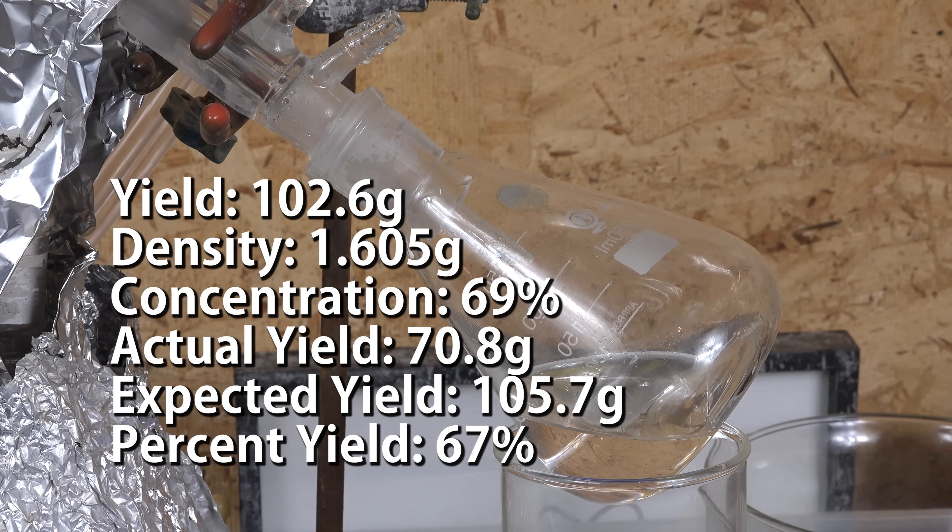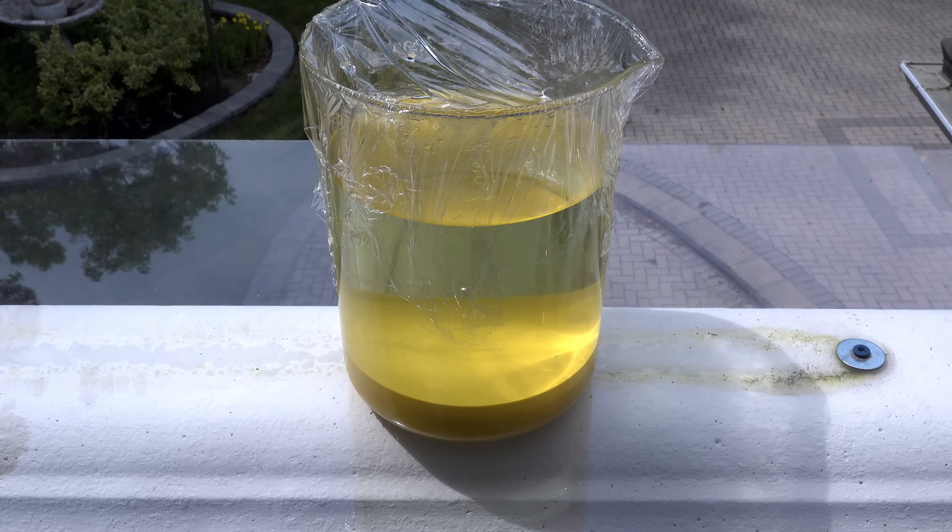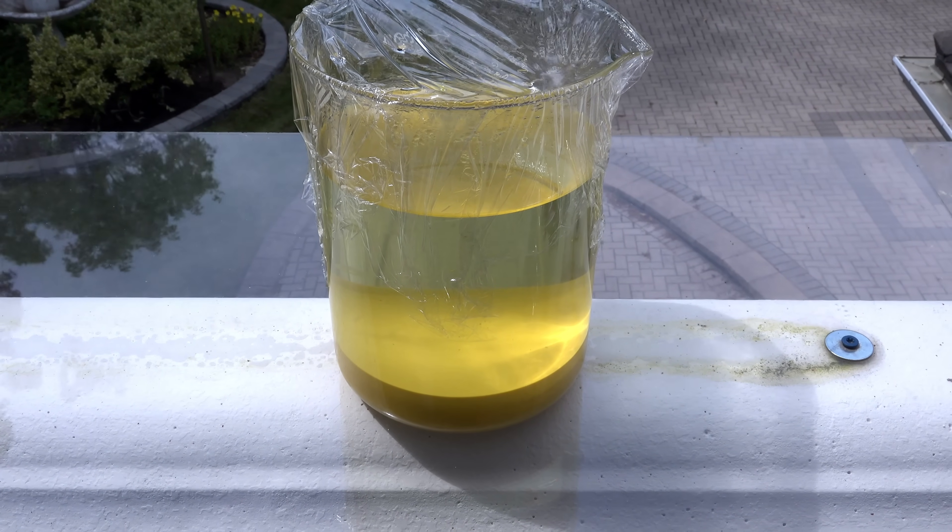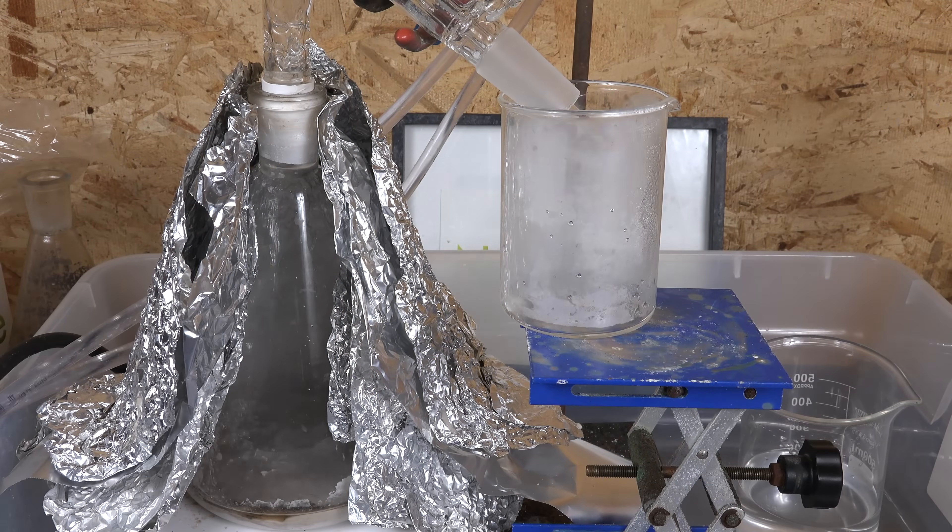I'm actually impressed that simply leaving it out in the sun creates such a big yield improvement. Maybe if I left it out for a week I'd get even better yield. But I'll leave those experiments to someone else who isn't as lazy. So I hope that video was useful to you.